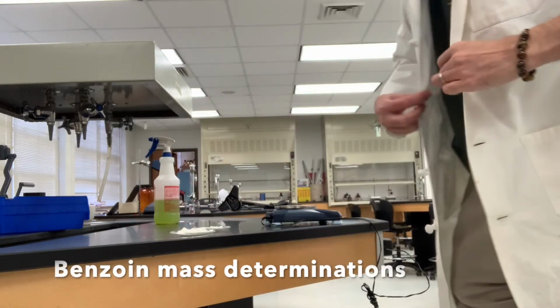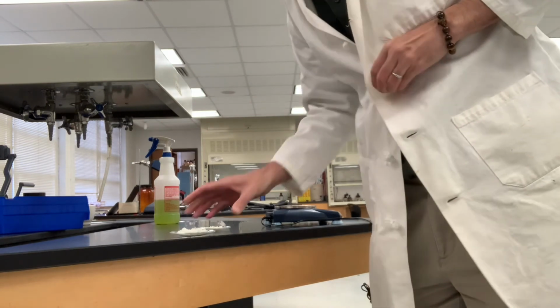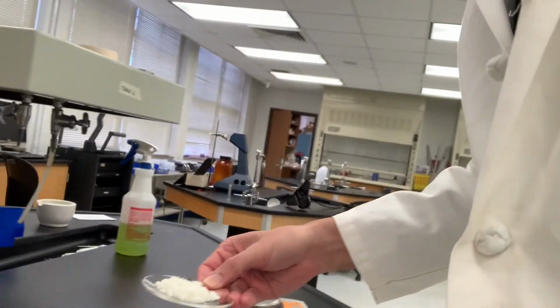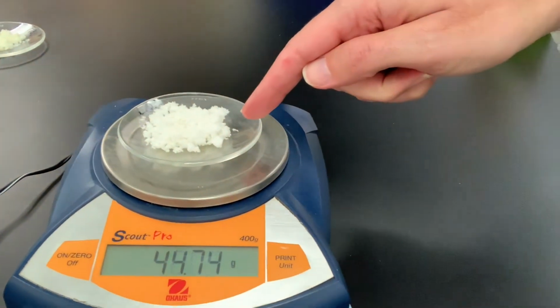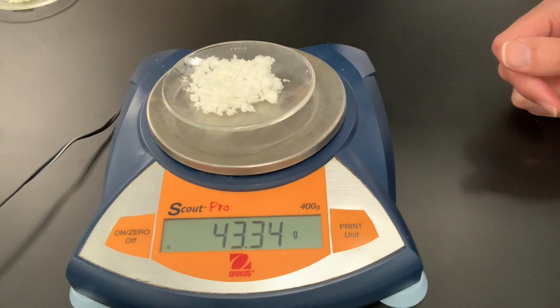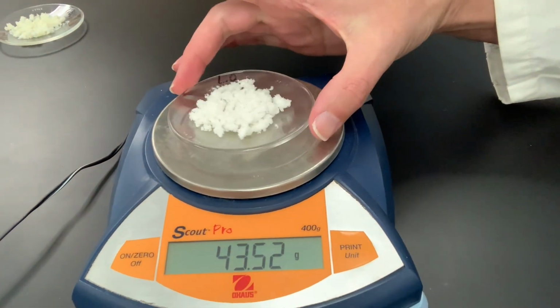I'm here to weigh the products that we produced. So we've got the first one here, the Lauren Oils product. It's got LO on the watch glass. And I'm going to bring you over here and put this on the balance that's zeroed. And remember that this is the weight of the watch glass and the crystals, so don't forget to subtract the weight of the empty watch glass. So this is the Lauren Oils reaction.